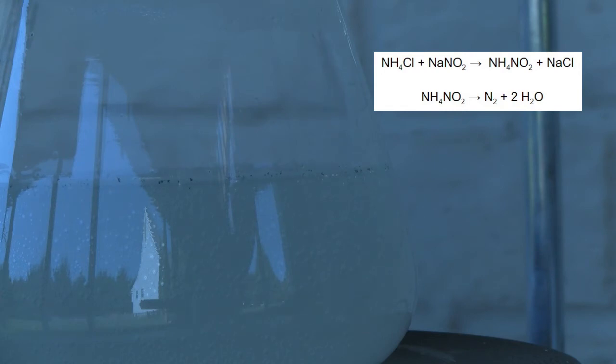This decomposition can be sped up with some heating but my cheap hot plate boils water even at its lowest setting so a controlled decomposition of nitrogen becomes harder in my case. If you want a steady and gentle flow of nitrogen heat this solution gently with constant stirring.